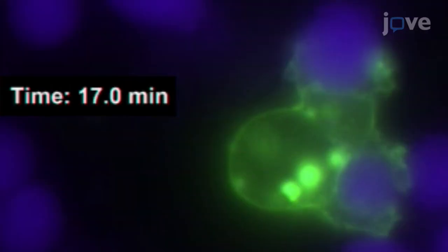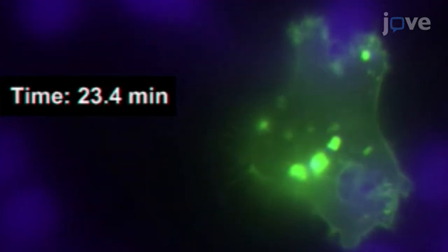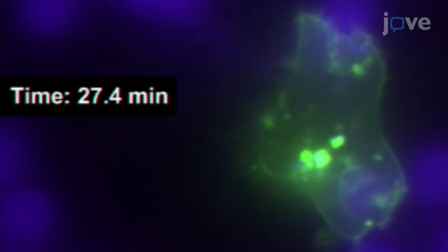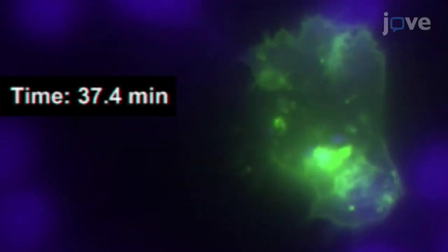The optional transfection of the Jurkat cells will allow the visualization of the traffic of the secretory granules in living cells. For instance, when GFP-CD63 is expressed, the movement of the GFP-CD63 decorated vesicles can be recorded. The protocol is compatible with endpoint fixation protocols that will allow further immunofluorescence staining protocols and analysis.